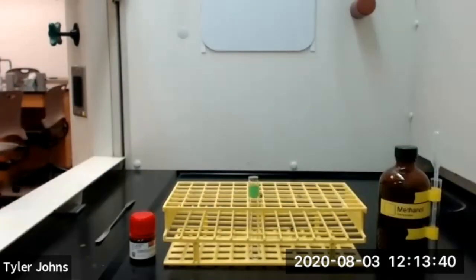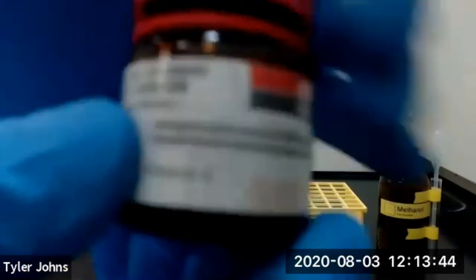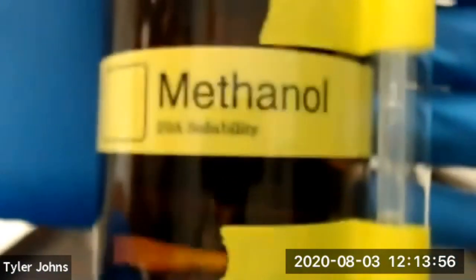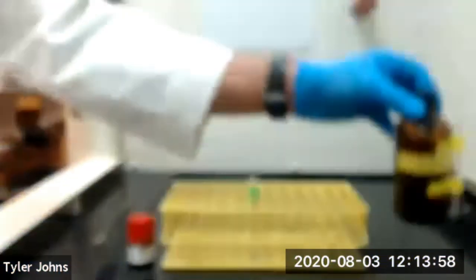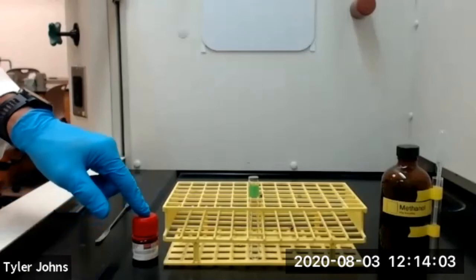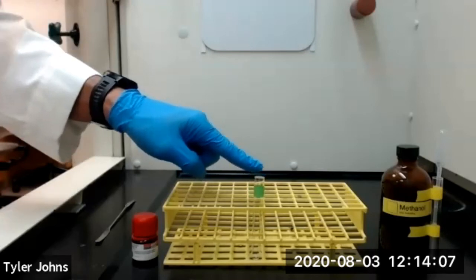In section 3 of part E of this experiment, we're going to determine the solubility of tetraphenyl cyclopentadienone in methanol. We first need to transfer 25 milligrams of our tetraphenyl cyclopentadienone into a clean, dry test tube.